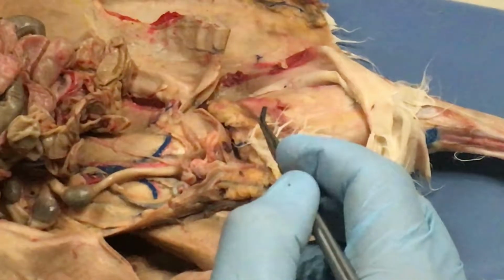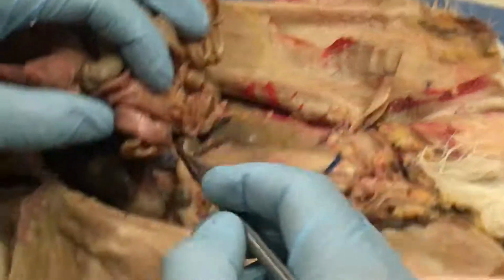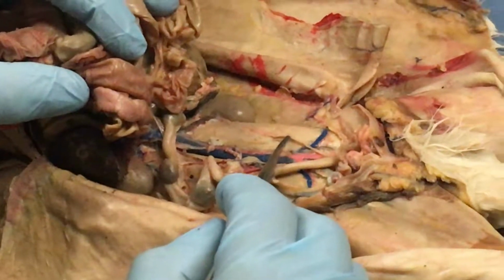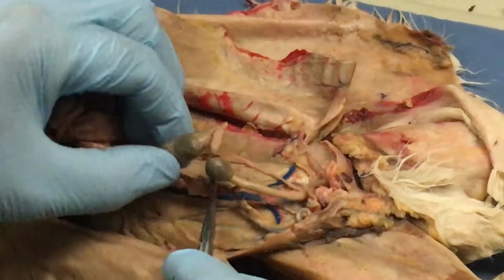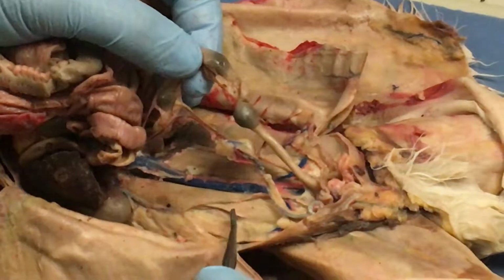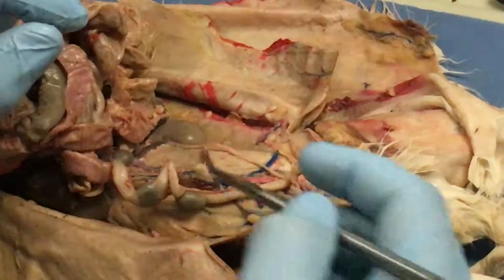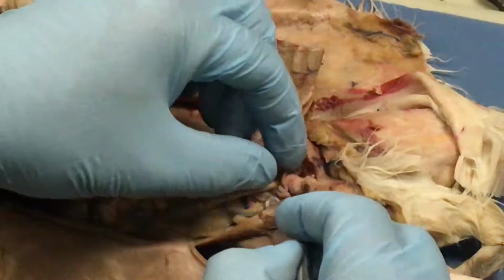Okay. All right. Kidneys. Got a kidney here. Kidney here. Okay. The ureters. We've got one on this side, and then we've got the one on this side. The ureters. Okay. The urethra. We haven't really even studied the urethra.